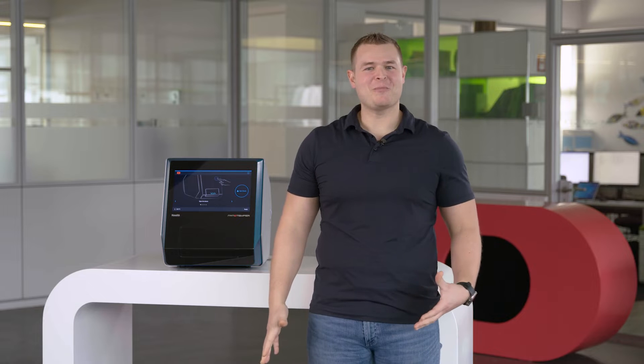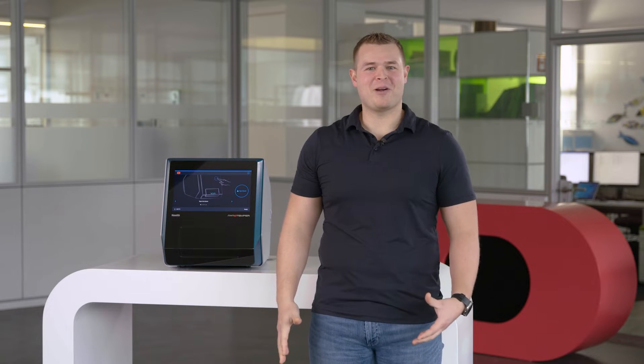Hello everyone, thank you for joining me today. Today we're going to be learning about our Monolith X instrument and how it helps you find affinities for all of your targets of interest, and we're making those affinity measurements completely in solution.